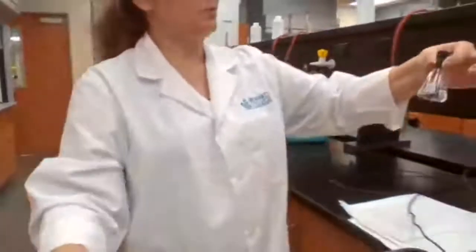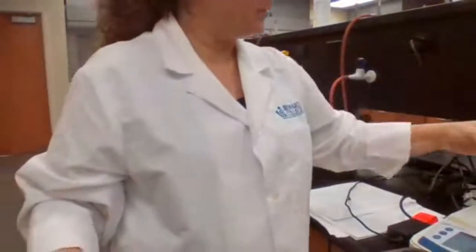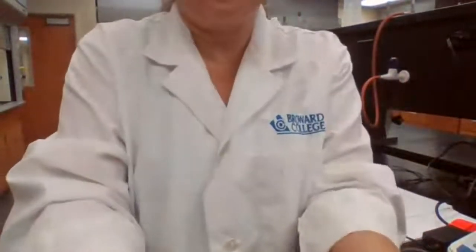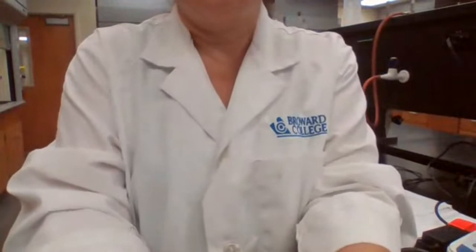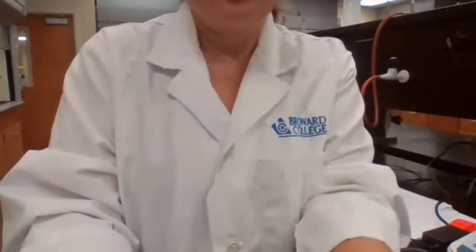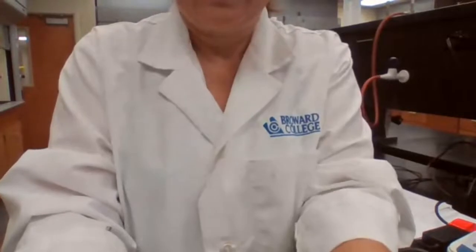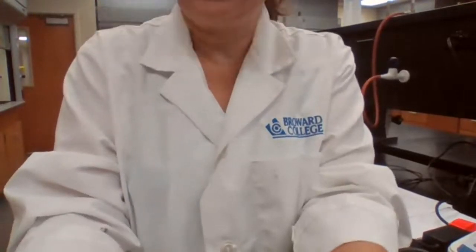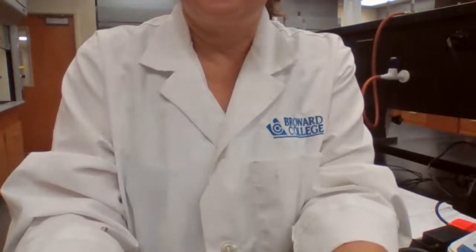And measure the mass. The flasks, both of them are 50 ml flask or 25 ml flask, but the mass is not the same. So it's hard to assume that they are going to be the same mass. So you should always measure the mass actually. Point .043.